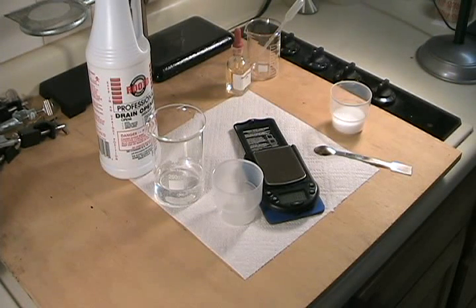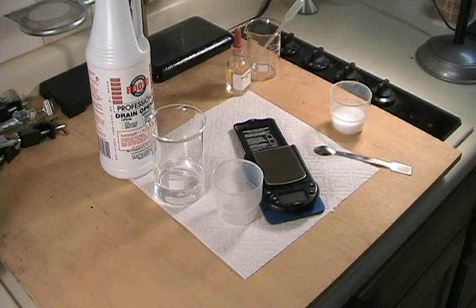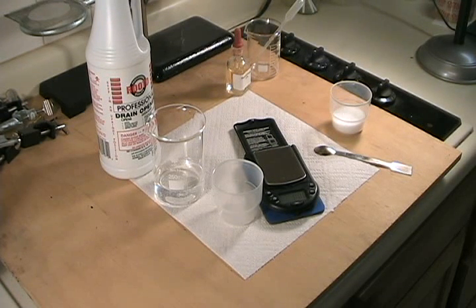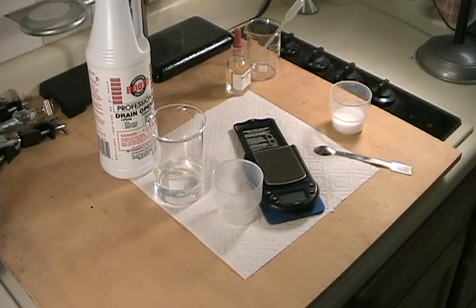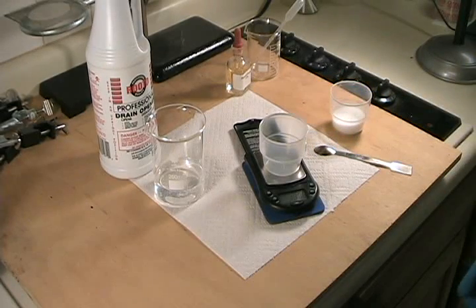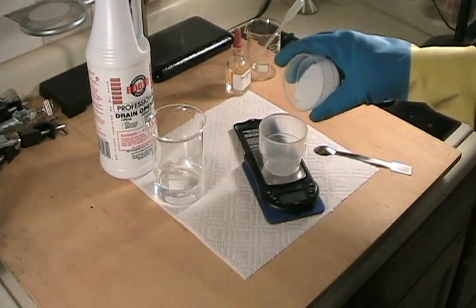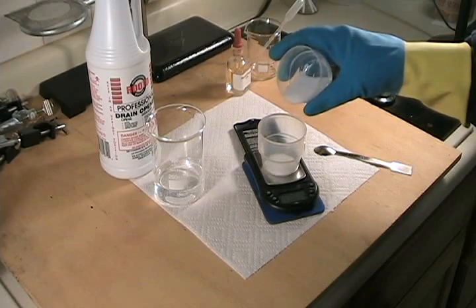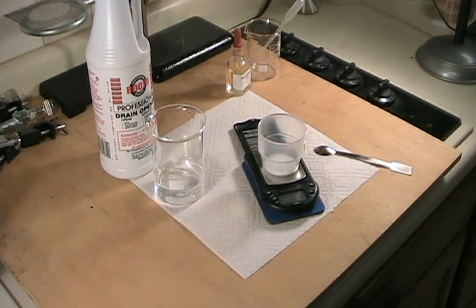The next step is to weigh out some sodium hydroxide to neutralize our acid aliquot. The gram molecular weight of sulfuric acid is about 98.08 grams per mole, and one mole of sulfuric acid reacts with two moles of sodium hydroxide to form sodium sulfate. The gram molecular mass of sodium hydroxide is just under 40 grams per mole, so we estimate we'll need about 0.2 moles of sodium hydroxide. We'll transfer about 10 grams — a slight excess. We have 10.10 grams of sodium hydroxide in that container.